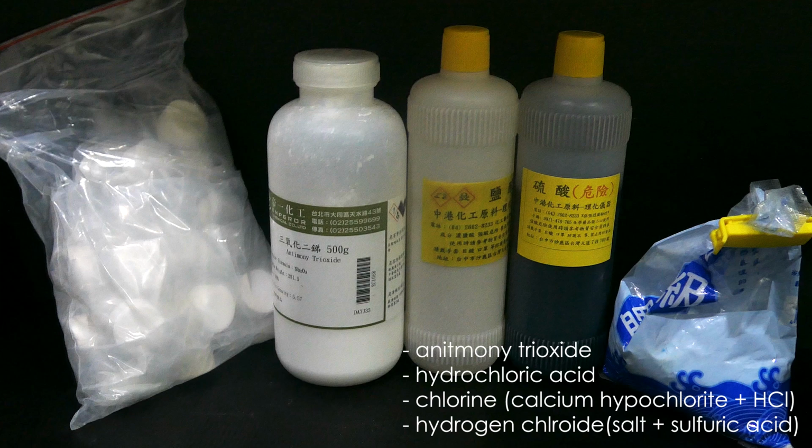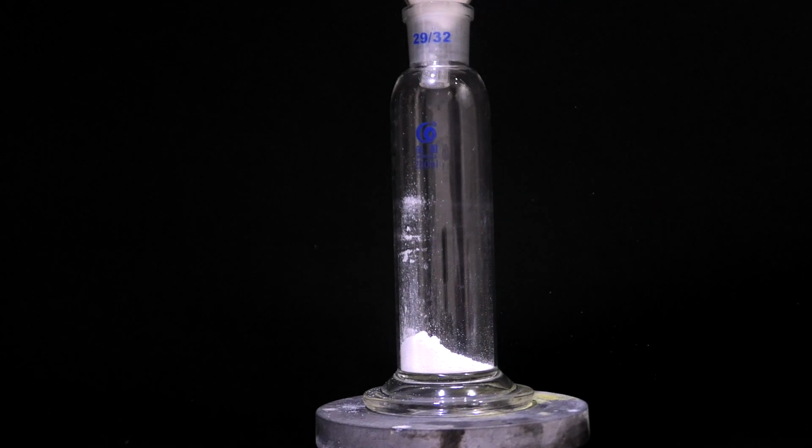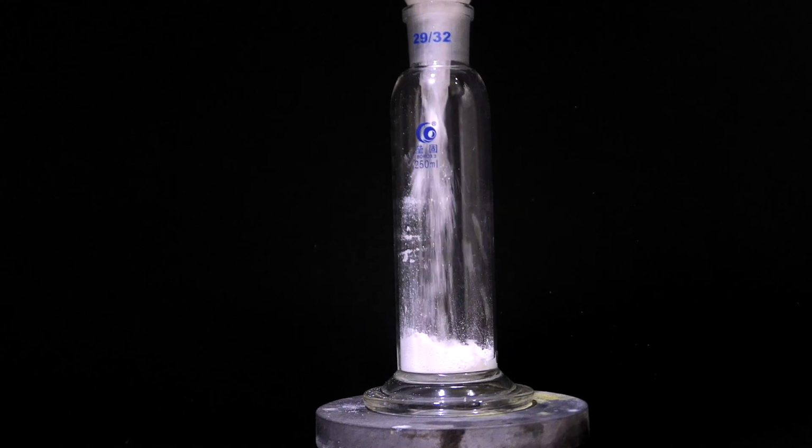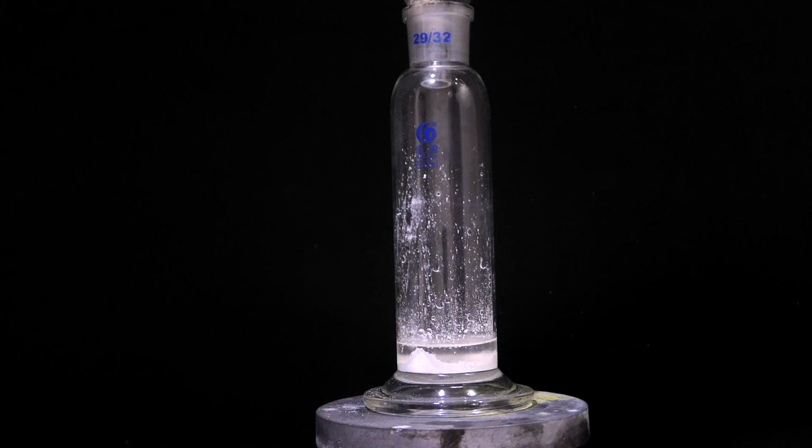In terms of chemicals, there are some chemicals needed: antimony trioxide, concentrated hydrochloric acid, calcium hypochlorite, concentrated sulfuric acid, and sodium chloride. First, 15 grams of antimony trioxide is charged into a bubbler. Then, 30 grams of concentrated hydrochloric acid is poured in and thoroughly mixed.